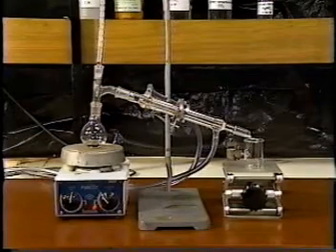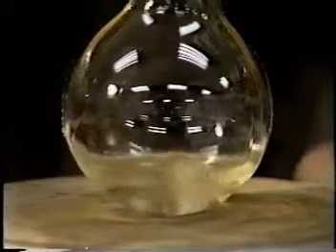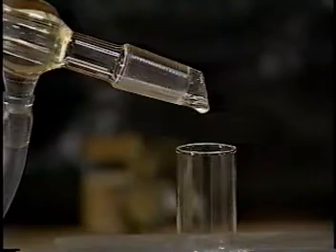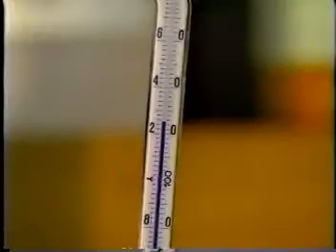This is how our distillation apparatus should look. Our product at the moment is slightly colored, whereas pure butyl ethanoate is colorless. Heat is applied and as the solution boils, the vapor rises. These early products coming off at around 117 degrees Celsius are cooled in the condenser tube and collected. The first few drops that come across are impure because the temperature was too low, so we discard them.